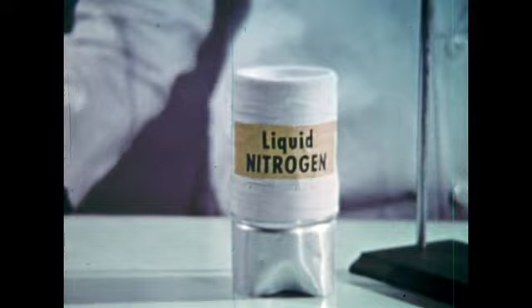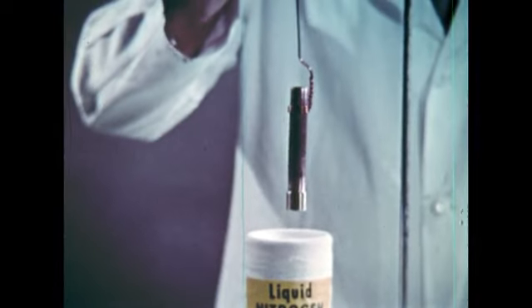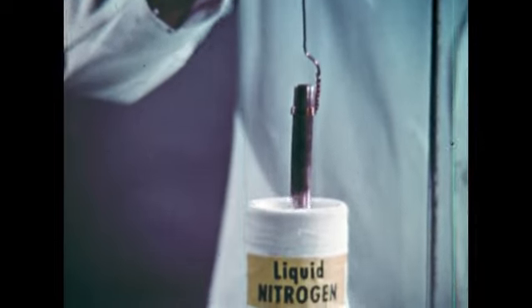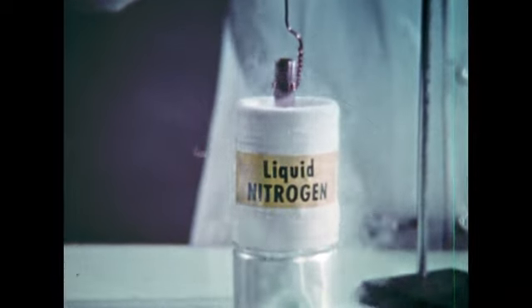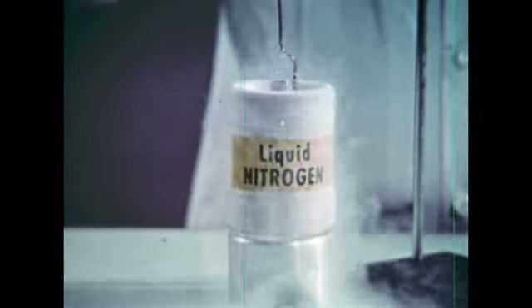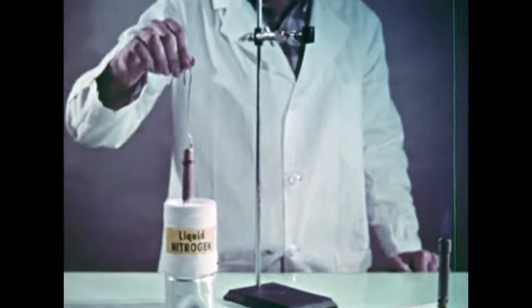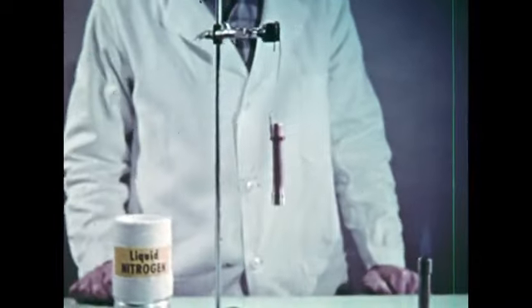This time we're using liquid nitrogen as a refrigerant for this hollow copper tube, which we'll fill to bring its temperature below the boiling point of oxygen. The nitrogen is spitting and boiling over as we cool the copper tube down to the temperature of the very cold liquid nitrogen. When the copper tube is hung in the air, its low temperature makes the oxygen condense out of the air on its sides and run down in liquid form.